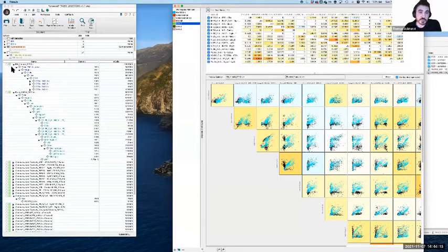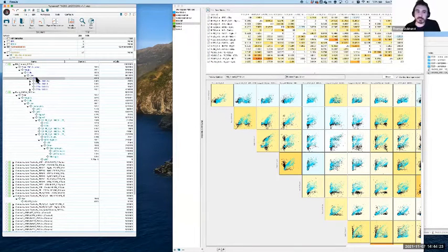In this case, it's actually important to apply it to all samples, and for reasons which we'll come to in a minute. Before I get stuck into dealing with the messy, uncorrected data, are there any brief questions or comments anyone would like to make at this stage?